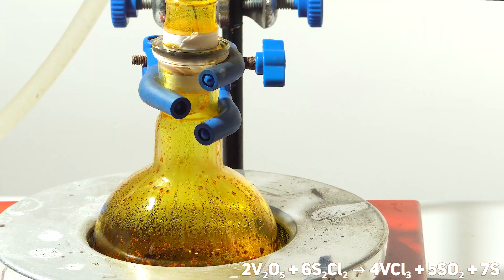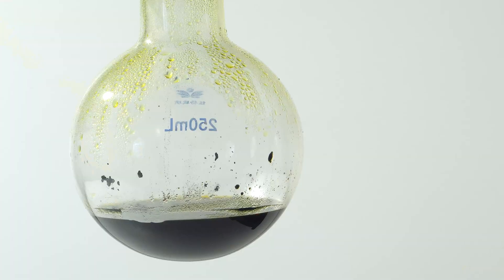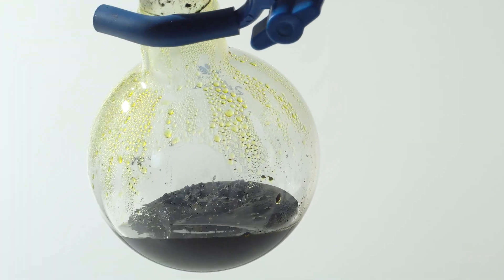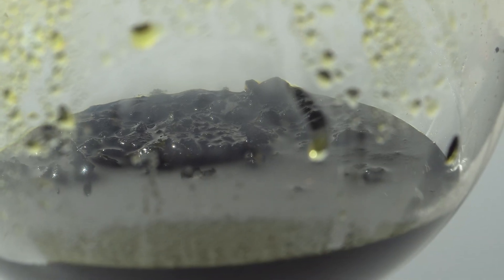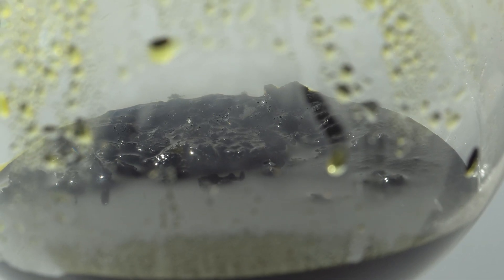After completion of the reaction, we will obtain a dark purple mass consisting of vanadium trichloride, disulfur dichloride, and elemental sulfur.